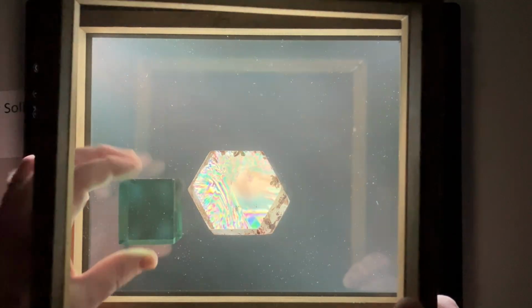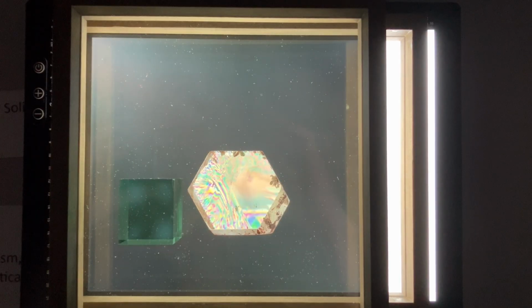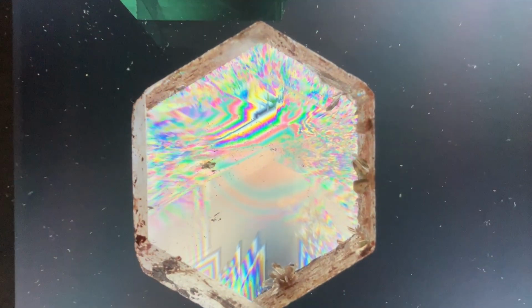Let's go back to our original setup looking down the C axis of our quartz crystal. At this point of the demonstration, I usually bring in a converging lens in order to generate something called an interference figure. However, we can actually do the same thing just by bringing our camera close to our crystal, since our camera also has a converging lens in it, and that's what we'll try today.